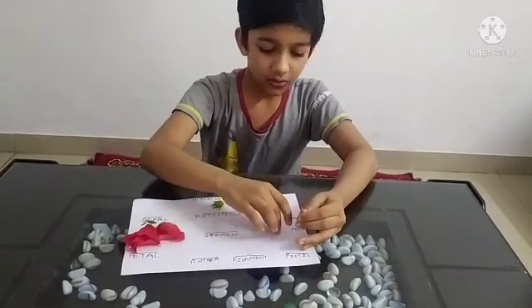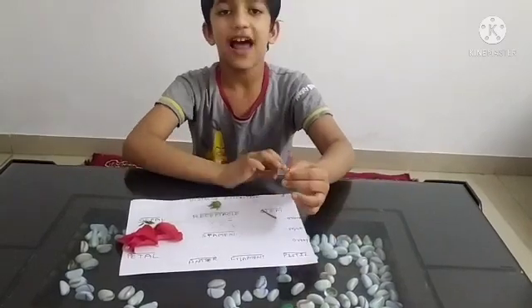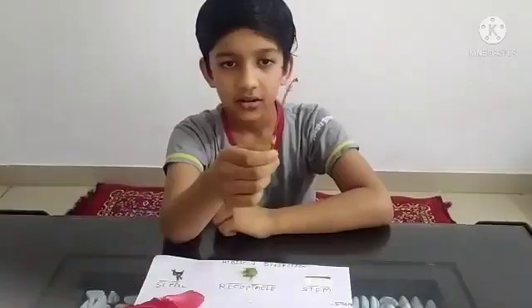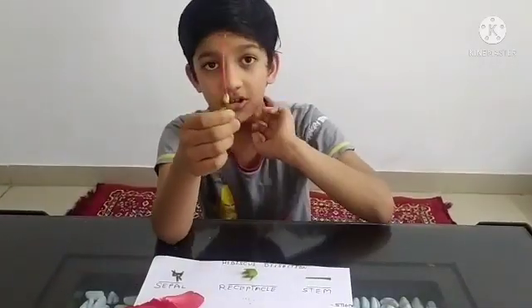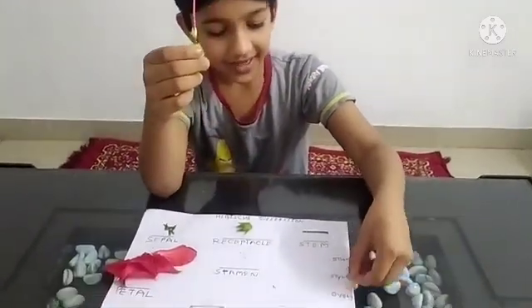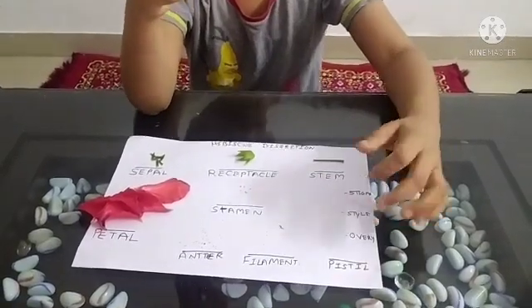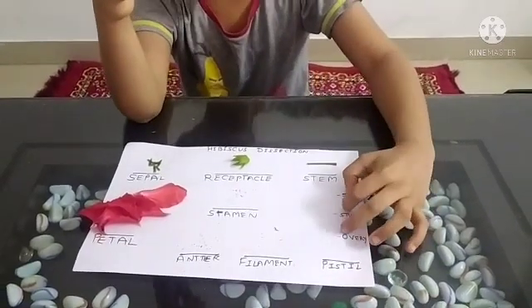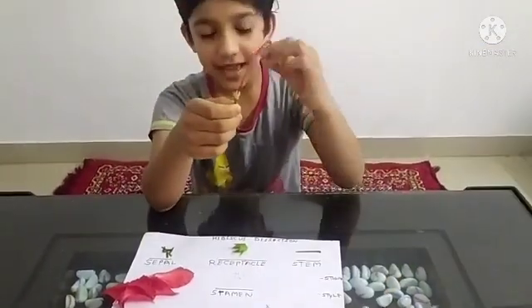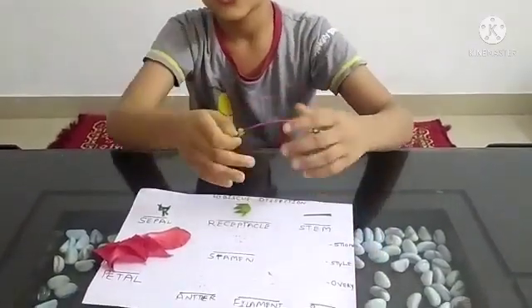Now there are only the female parts of the flower left. This is our female part. It consists of three parts which are the ovary, style, and stigma. We combine these three and call the female part the pistil or the carpel.